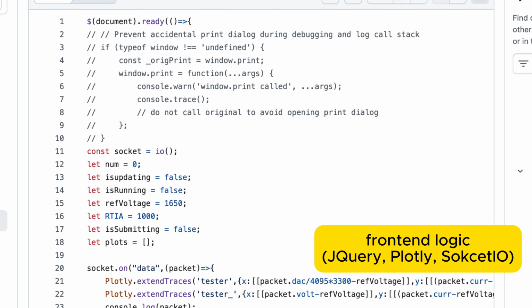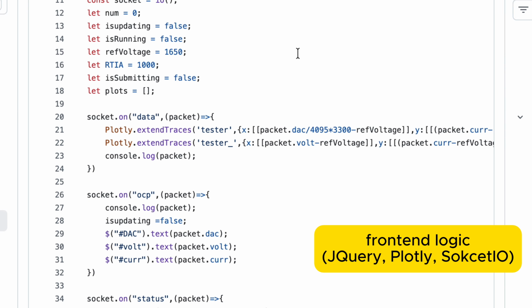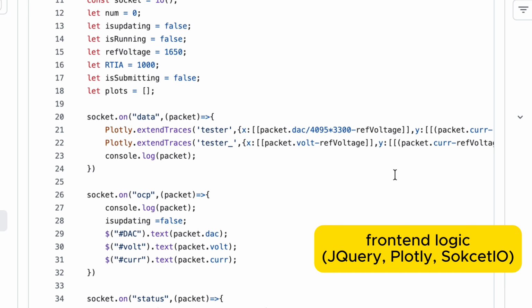Handling serial data usually involves WebSocket. WebSocket is used for communication between server and client back and forth. This way, the client can receive as well as send data. In this case, the front end sends data regarding measurement parameters and setup. It also receives measurement data and the state of the device. To plot the data, we use Plotly.js as the graph updates automatically and is interactive.